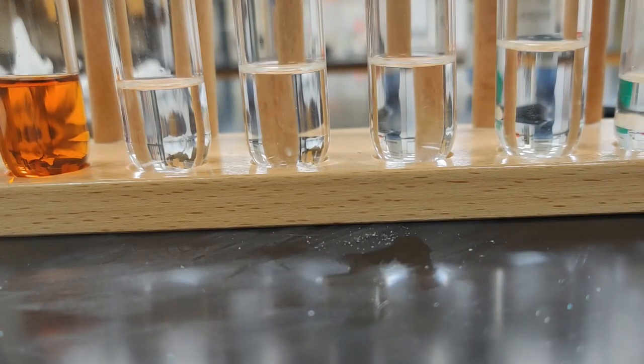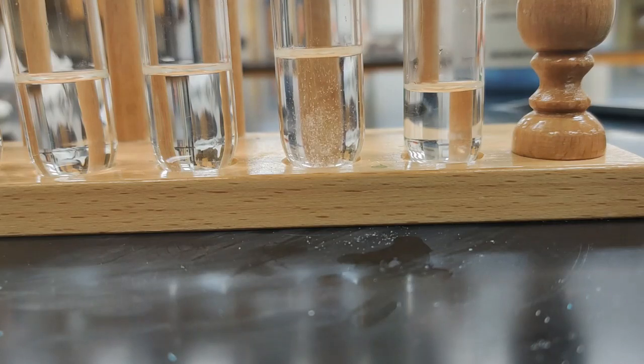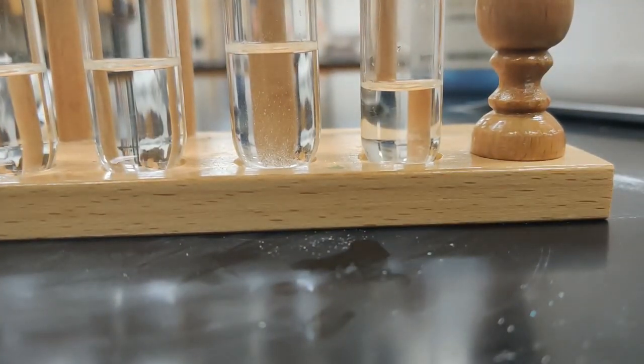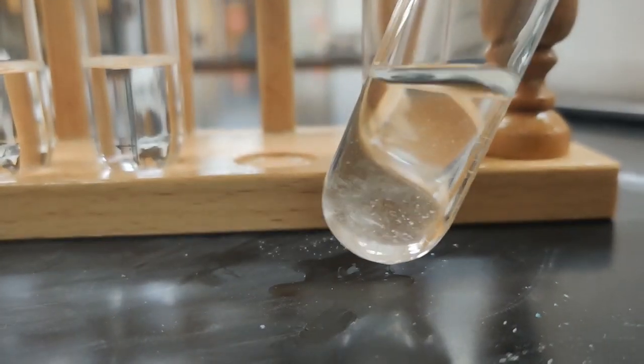So scooch this down so we look at our last two tubes here. We'll get just a little bit of glucose on the tip of our scoop and drop that down in there. Again, I do see that solid moving around, but I don't want to make a decision until I actually agitate it and try it, because we want to be fair.